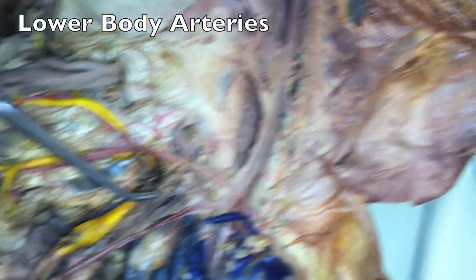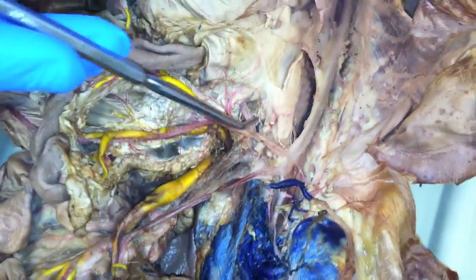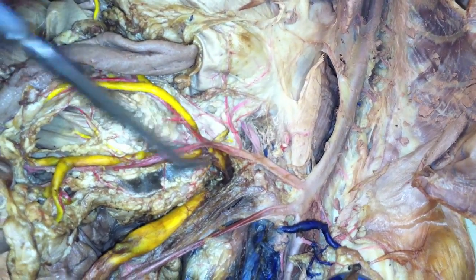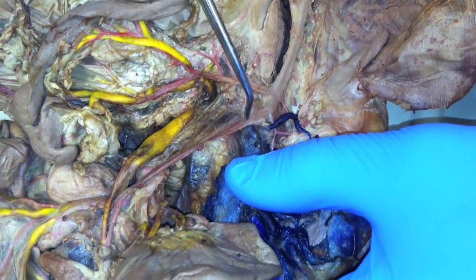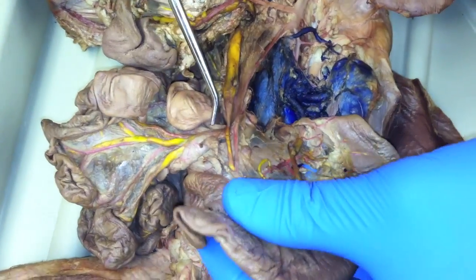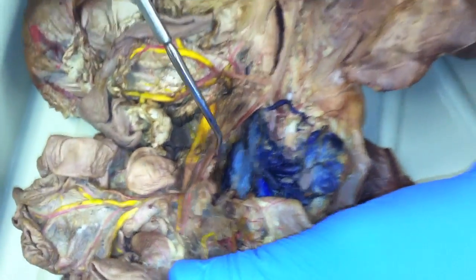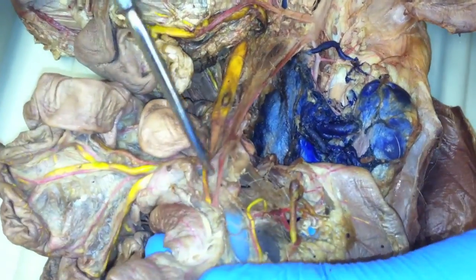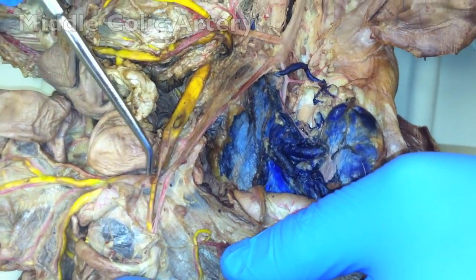This is the abdominal aorta. First branch is the celiac. And the first branch off the celiac is the hepatic. Hepatic coming off the celiac — first branch is the hepatic. The next branch is the left gastric, and then the final branch is the splenic. The second branch off the abdominal aorta is the cranial mesenteric, which goes into the middle colic and also iliocolic arteries. So cranial mesenteric, then iliocolic.